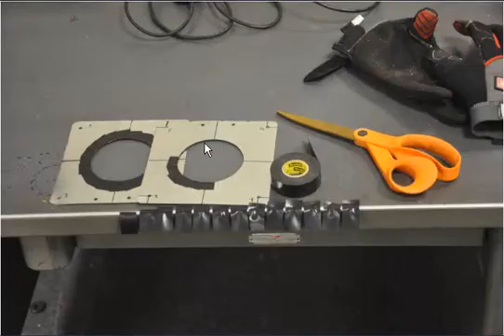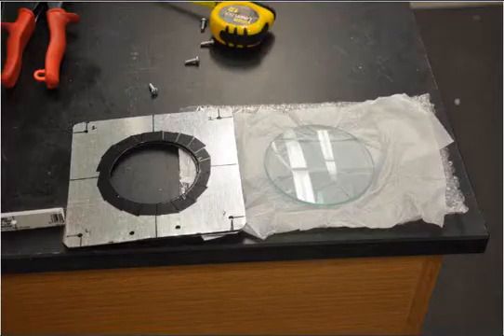And so that we don't scratch up the lens, because all we have here is rough cut steel plate, I'm going to wrap it in electrical tape, but any kind of gasket material would probably work just as well. We have electrical tape in the lab, so that's what I was using, just cutting little strips of it and wrapping it around the edges of both plates.